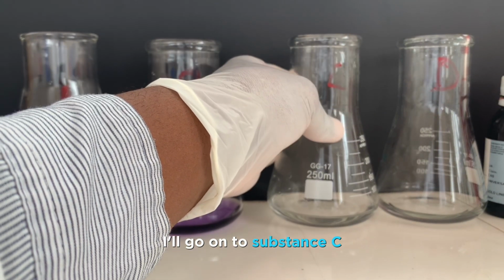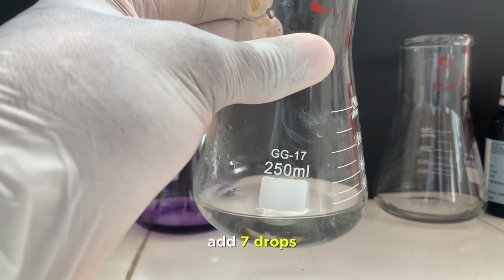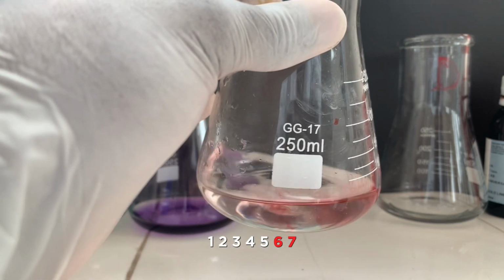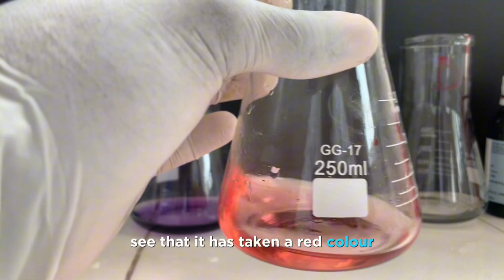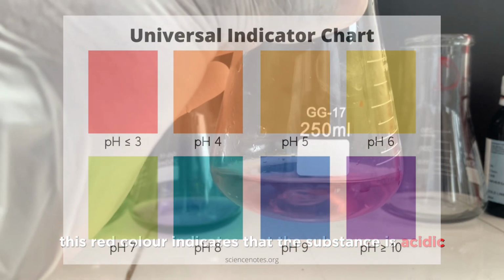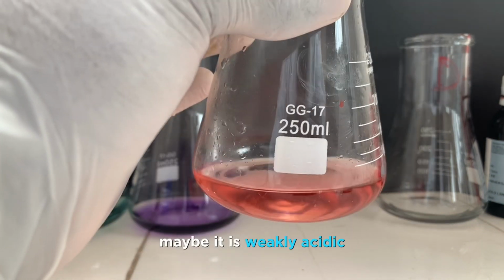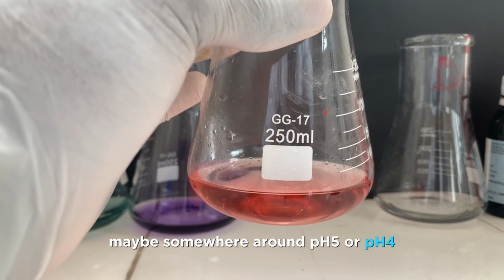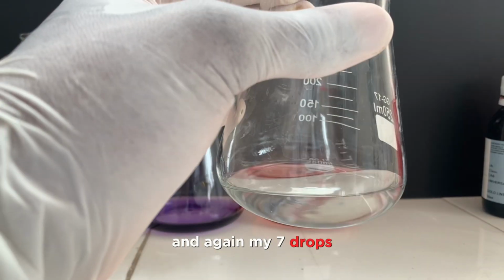Alright, move on to substance C, again another colorless solution. I'll use my universal indicator, add a few drops. Take note of the color changes, swirl as you are adding the drops so that you don't miss the color changes taking place. Here you see it has taken an orange reddish color. So this indicates that the substance is acidic, all right? And take note of the intensity of the color. It can help you determine the approximate pH. Maybe for this one, it is around pH 3 or 4.